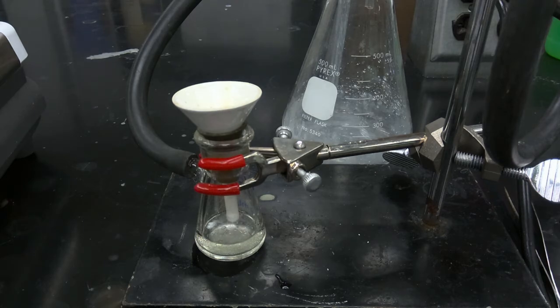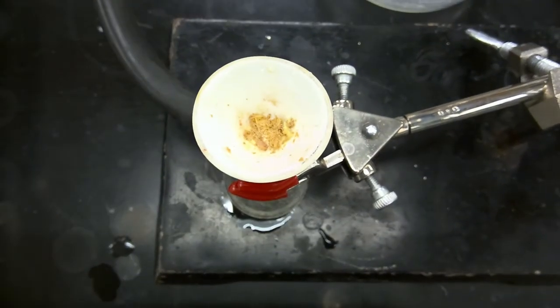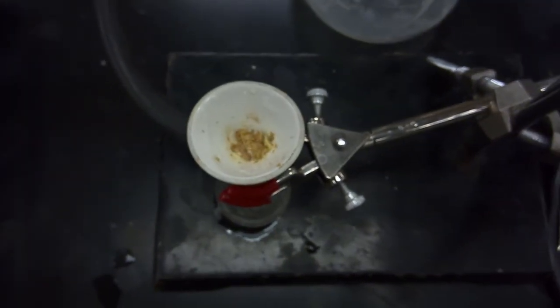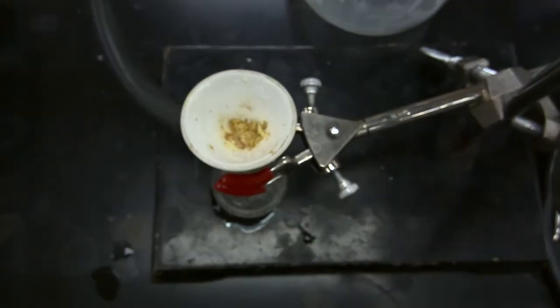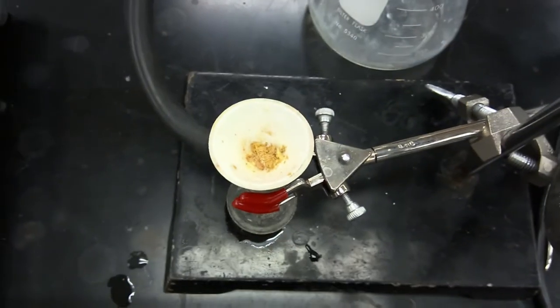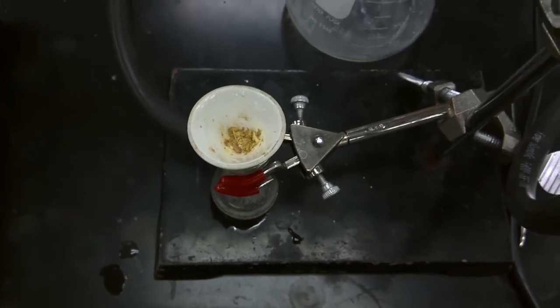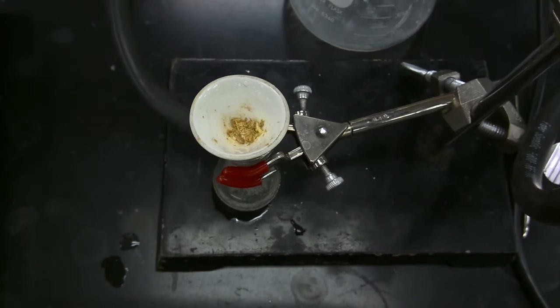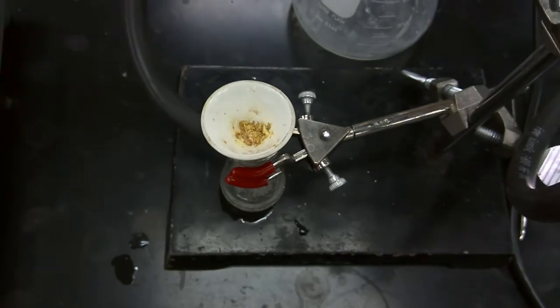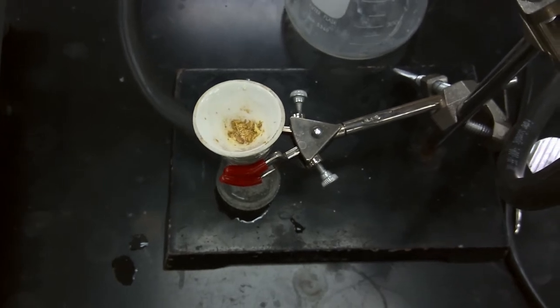Okay, so as we can see now, we've collected our purified solid via filtration. For an additional purification step, we're going to allow this solid to air dry on our filter for an additional 5 to 10 minutes. Then we're going to purify our product N-phenylmaleimide via trituration with hexanes. So we'll resume in about 5 to 10 minutes once our sample has finished air drying.